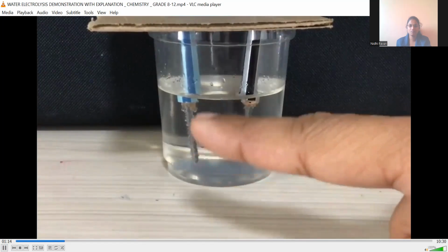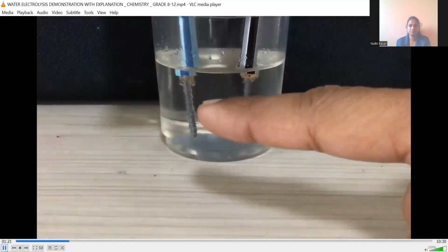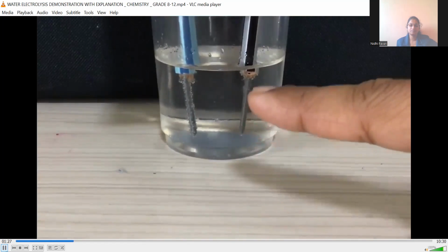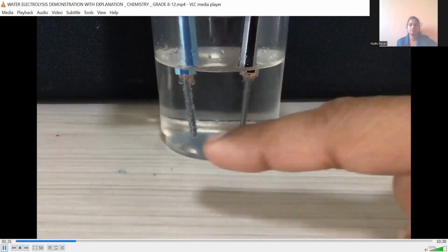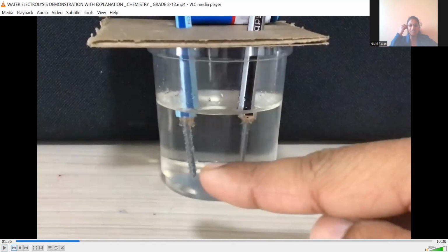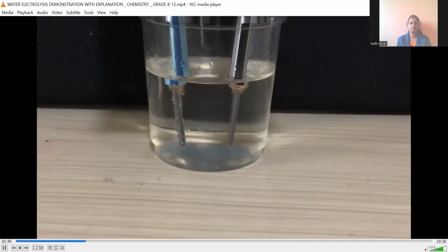Please don't look at the bubbles which have settled on the graphite, but at the bubbles which are rising up. They are very small and hardly visible, but fewer are coming up. You can see over here that a large number of bubbles are coming out from here. So this is the hydrogen gas and this is the oxygen gas. Hydrogen gas is emitted at the cathode, whereas at the anode oxygen gas is coming out, and the oxygen gas is collected at the anode. So very simple setup, as you can see by yourself. The volume of hydrogen and oxygen coming out is 2:1.